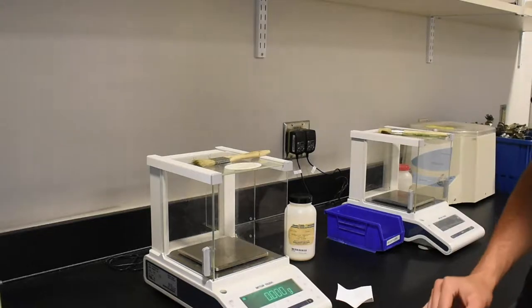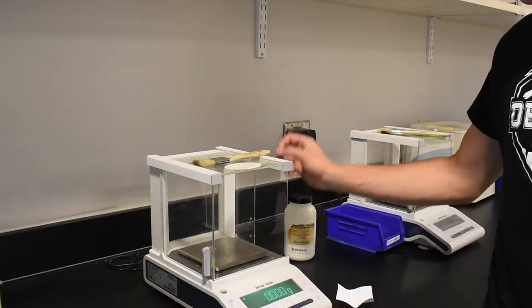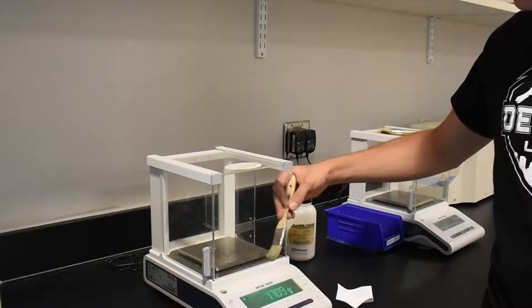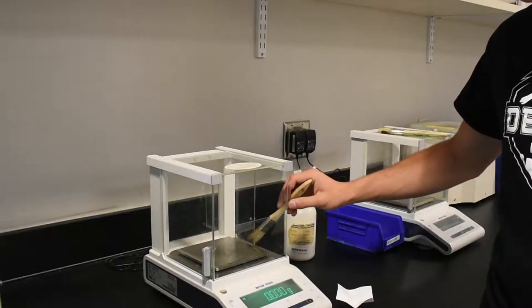The first step is to ensure the balance is clean. Remove any debris from the balance pan and the surrounding area using the small brush located near the balance.